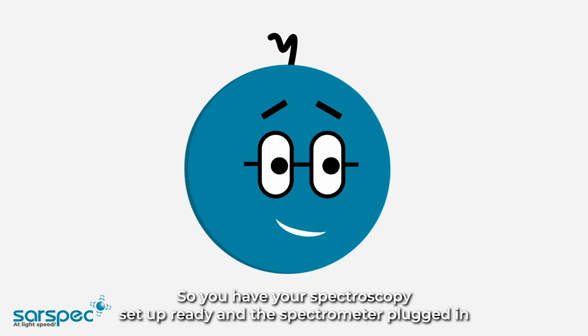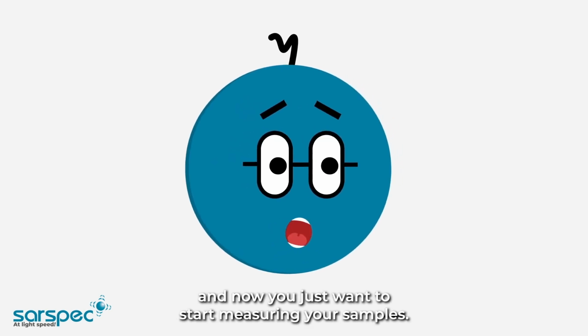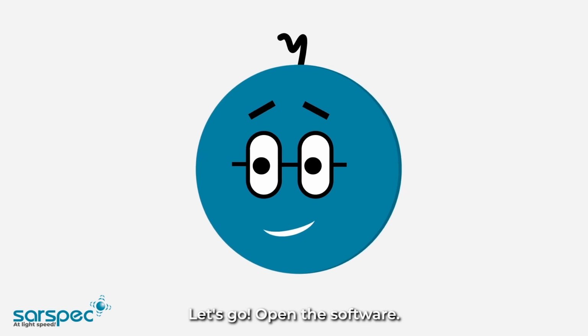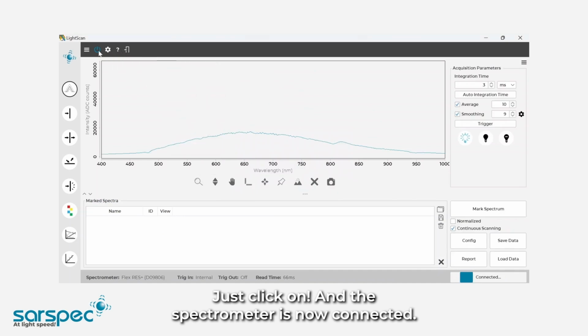So, you have your spectroscopy setup ready and the spectrometer plugged in, and now you just want to start measuring your samples. Let's go! Open the software. Let's start by connecting LightScan to your spectrometer. Just click on and the spectrometer is now connected.